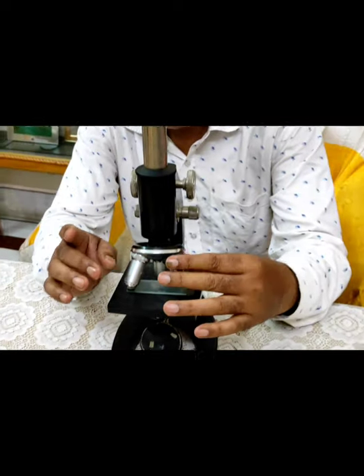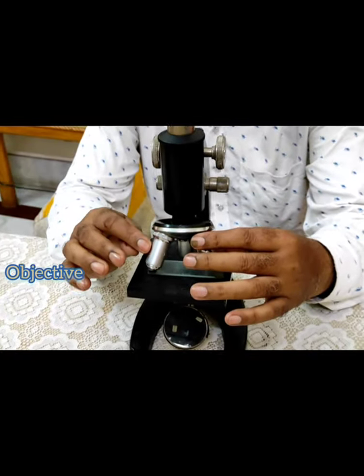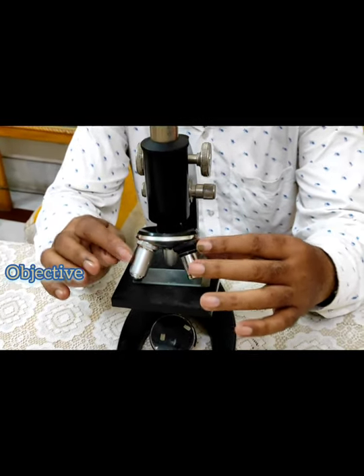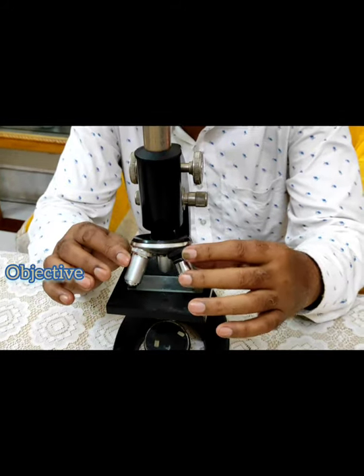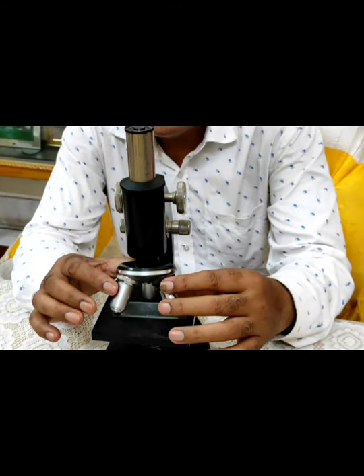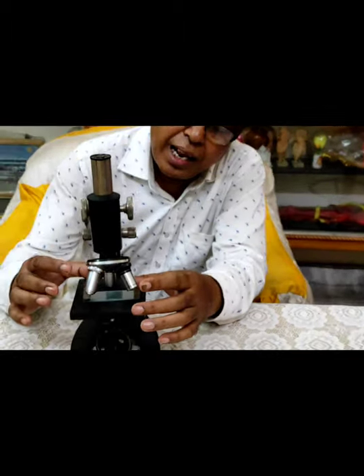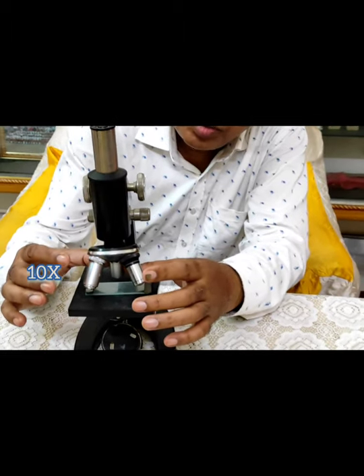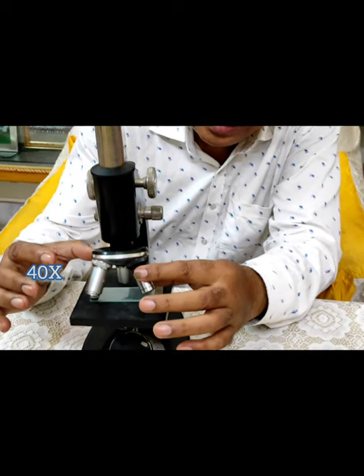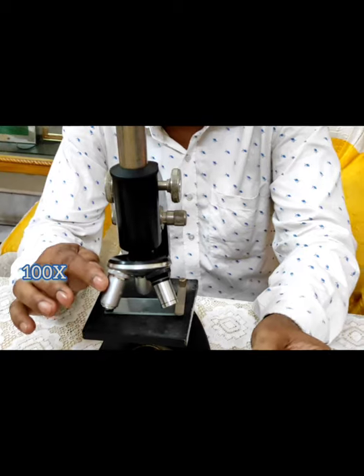This is the objective part. Normally there are three types of objective parts. We can see here 10x, 40x, and 100x.